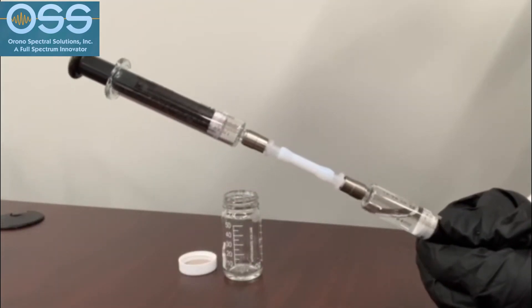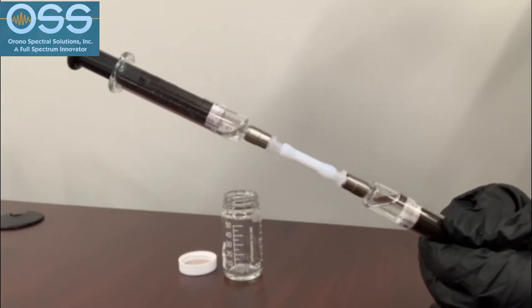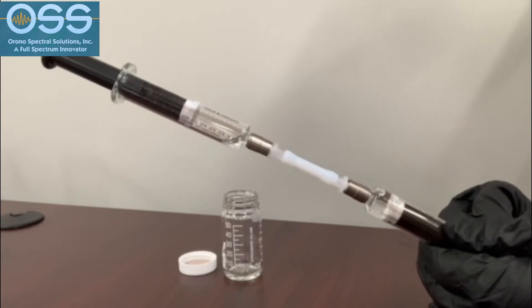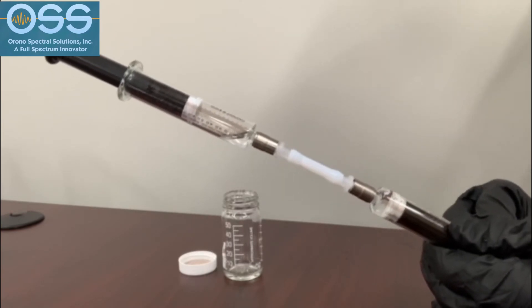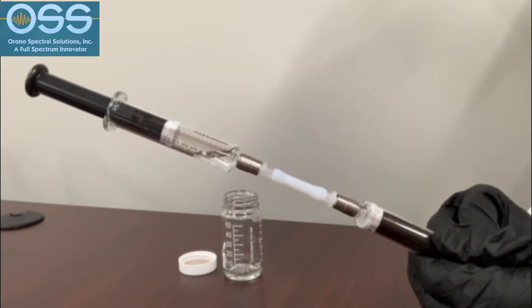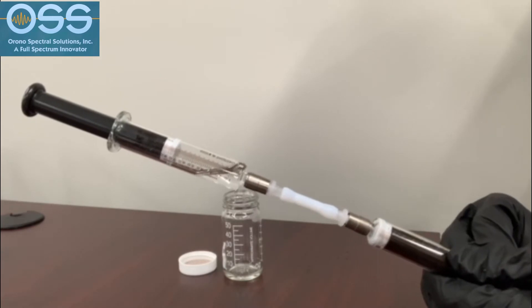The sample is pushed through the column a total of 4 times. The combination of a closed system and small solvent volume provides increased safety to the operators.